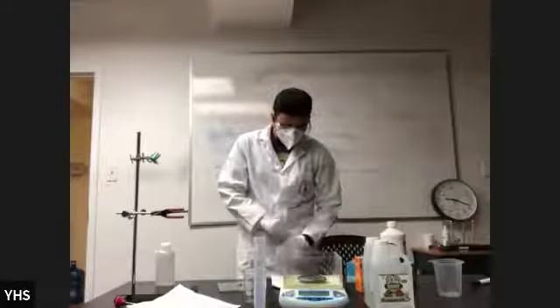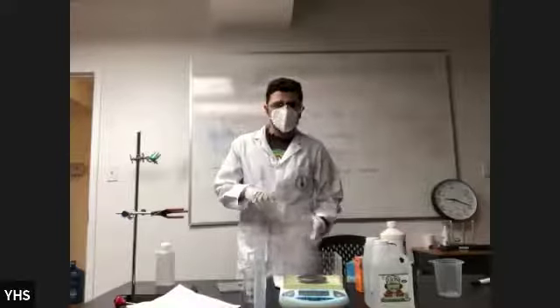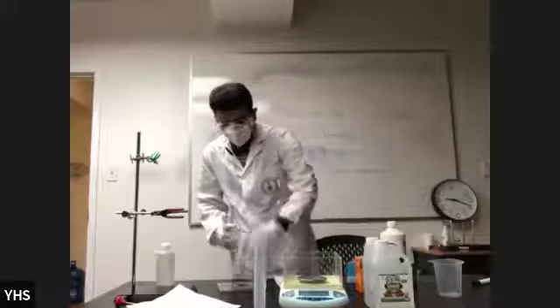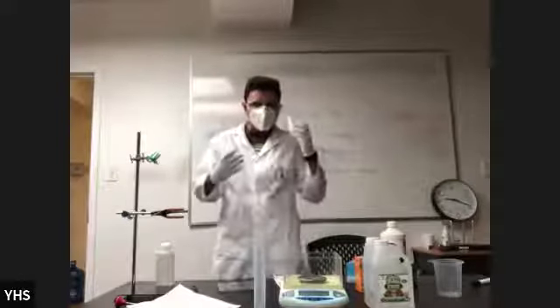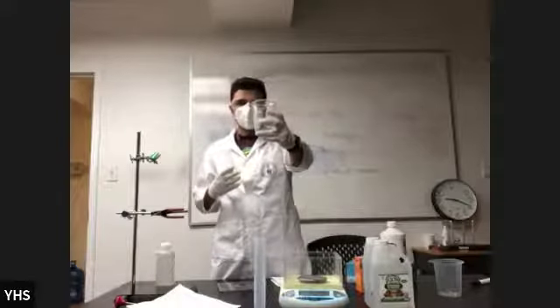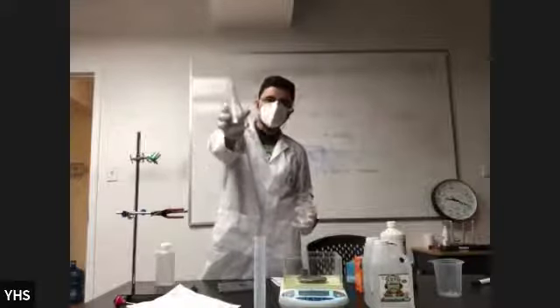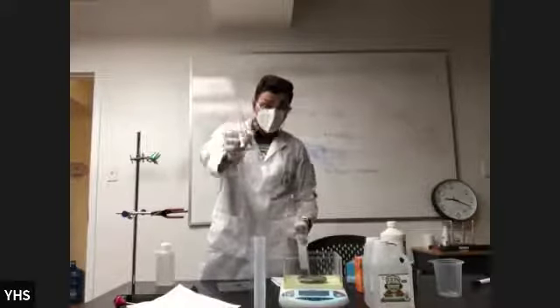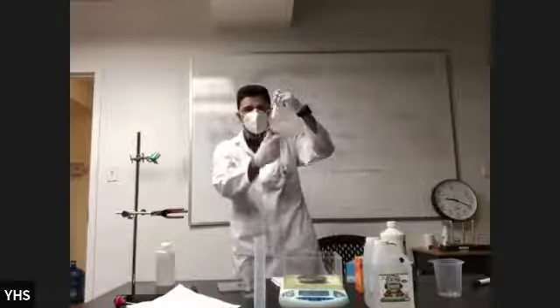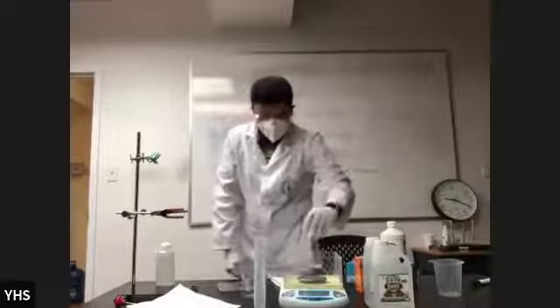Okay. So my job here is to try to be as precise as possible. So here's what I'm going to do, okay? For my solids, I'm going to use the beaker to measure my mass. For the liquids, I'm going to use this beaker right here, okay? The first thing I'm going to measure is the mass of this empty one. Remember, this is going to be for the liquid. I'm going to put it on my scale.